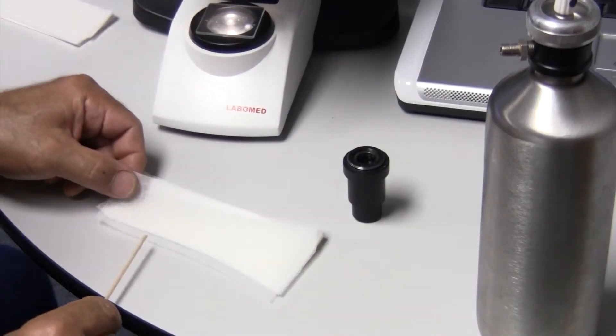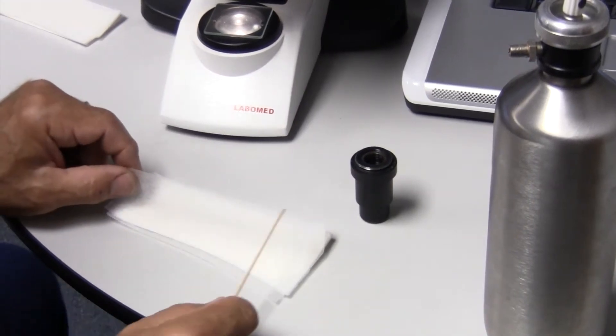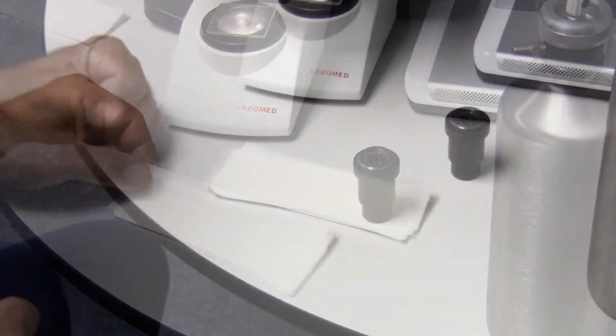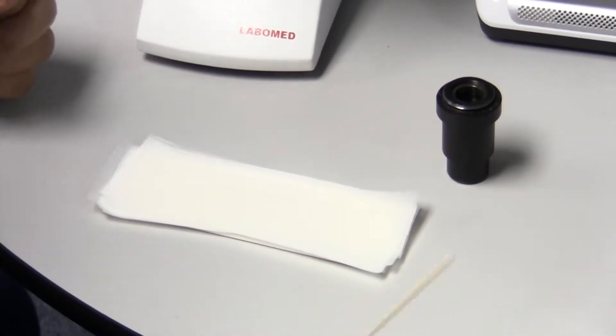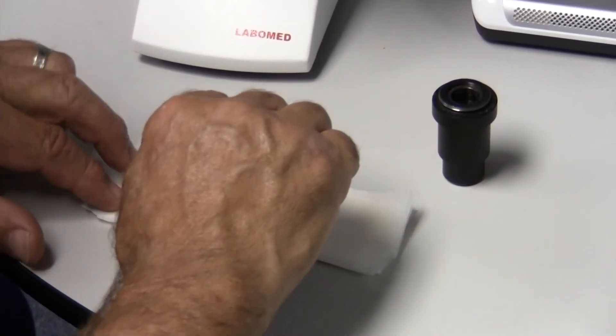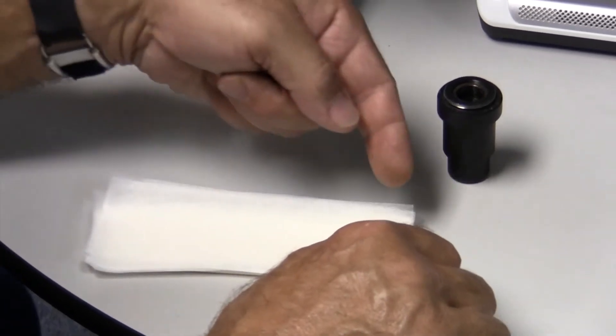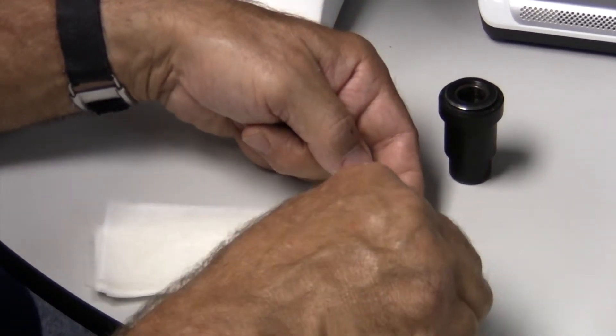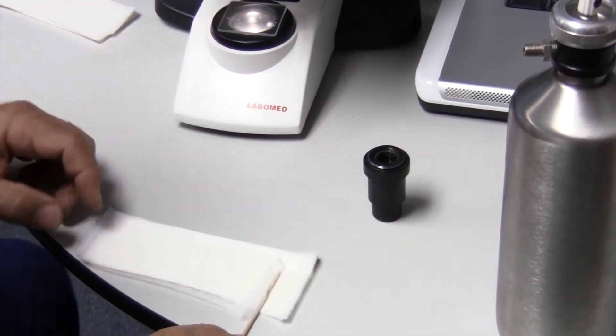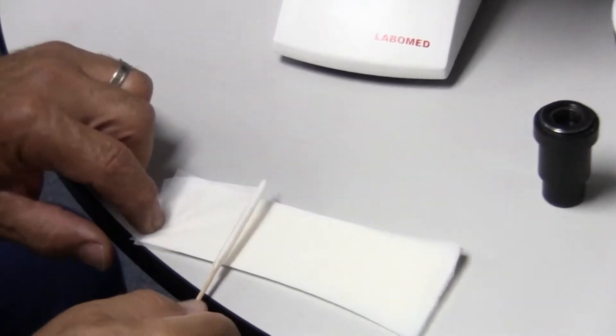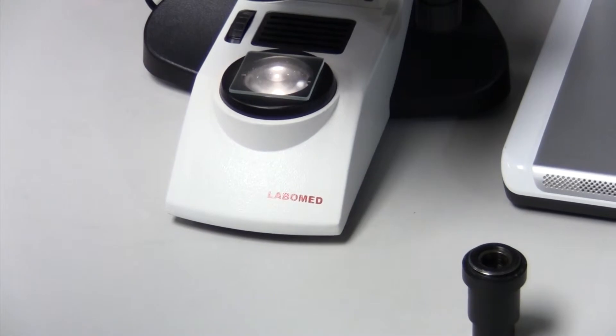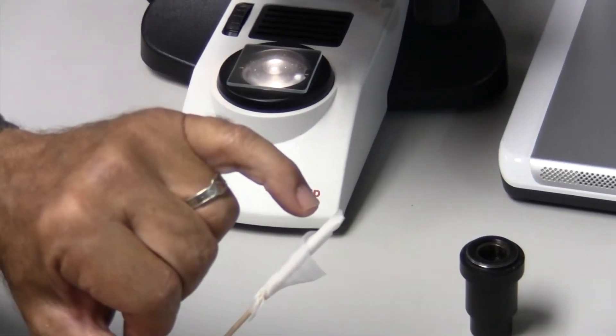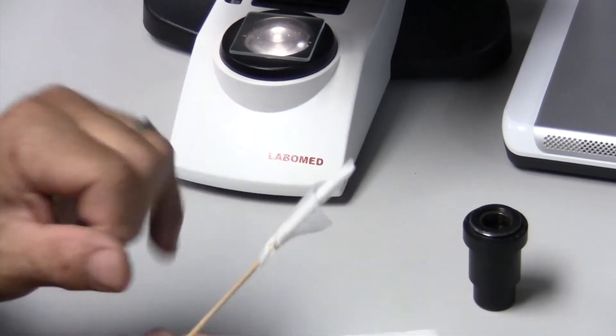The way I use this is take the original sheet, which is four by six inches, I cut it down the middle, and that leaves me with these little short pieces. After the paper is cut in half, take a small applicator stick, and I typically wet the end of it with just my tongue a little bit, and then draw a line and arc over the paper, and that will lift up an edge of the end of the paper. Use that edge to secure the stick to it, and then rotate the stick, building up a clean leading edge on the end of the stick. So this edge right here has never been touched by human hands. Then the back of it needs sealed back to the stick. Now you have a clean, dust-free, lint-free cleaning surface to work from.